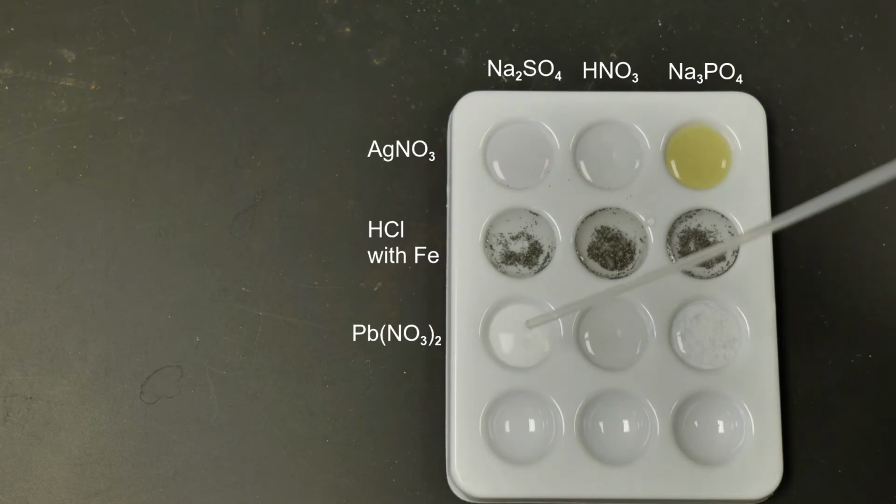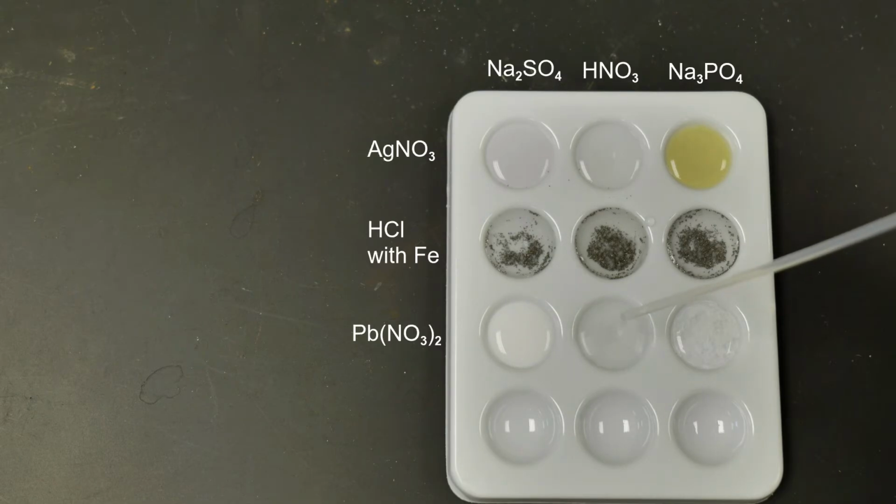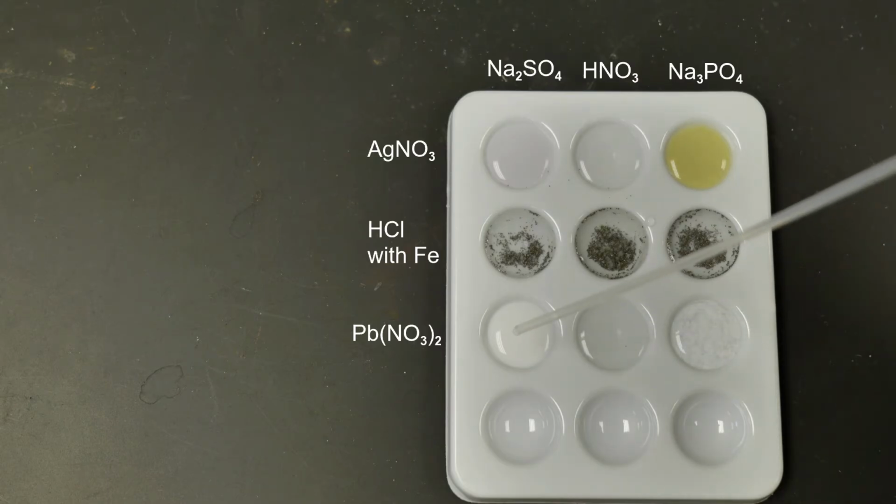I definitely see some changes occurring in some of these, so hopefully you're making the same observations I am and the camera is picking them up well enough. But if not, we will definitely talk about them in the post-lab discussion.